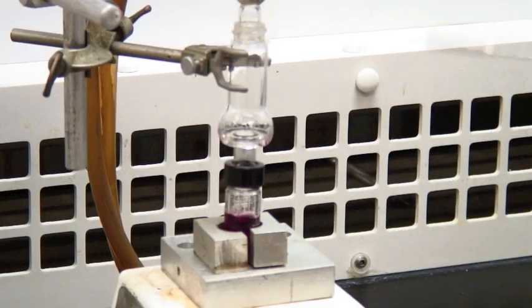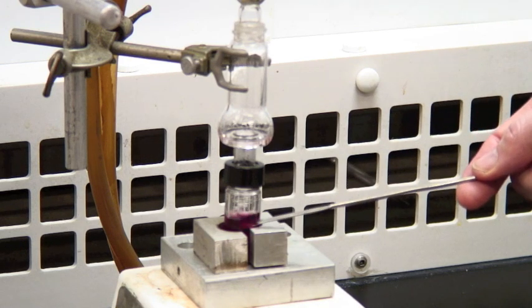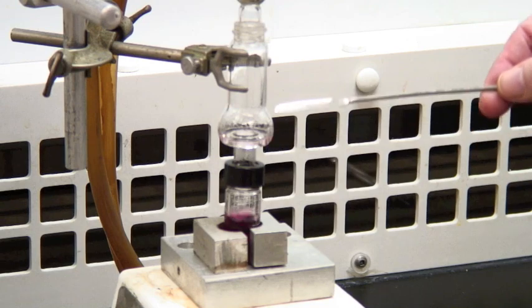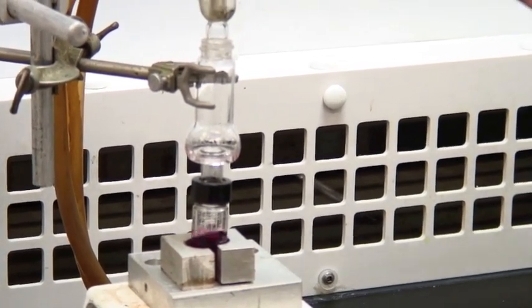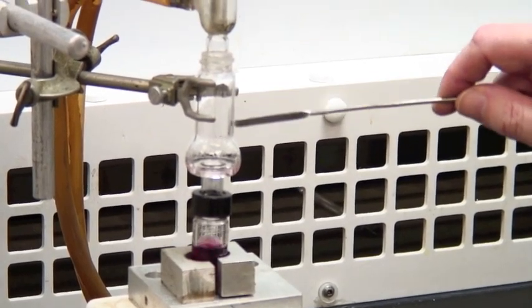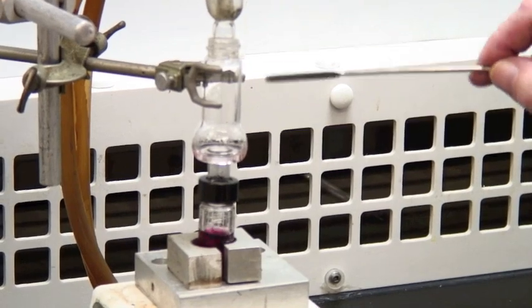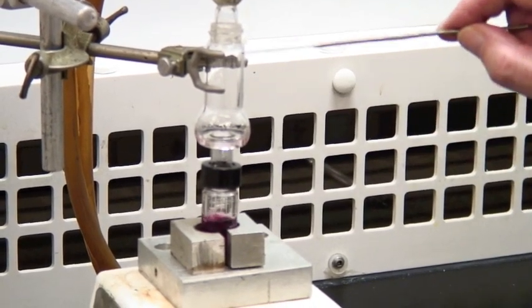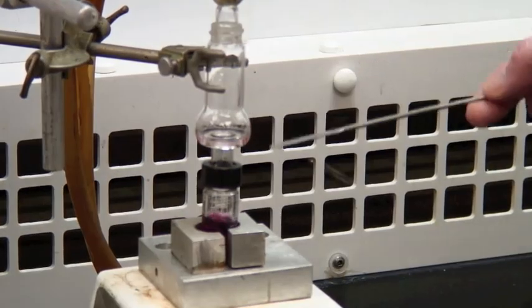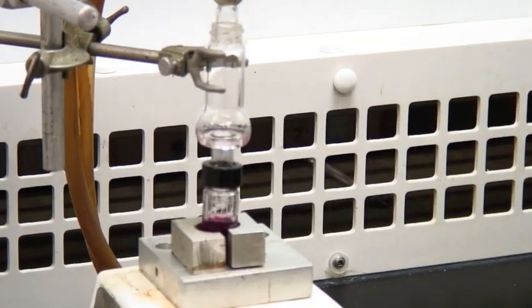We've left this for a while, and it's now actually distilling. You'll notice that the still pot is boiling down here, and the vapor comes up. It condenses. It's a rather damp day, so you can see condensation on the outside of the condenser. But if you look in the Hickman head, you may be able to see fogginess. And this is the liquid that we're distilling here is condensing around the Hickman head and collecting around here in the wells.